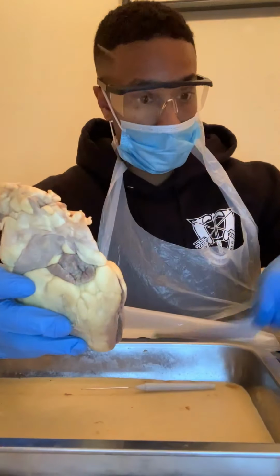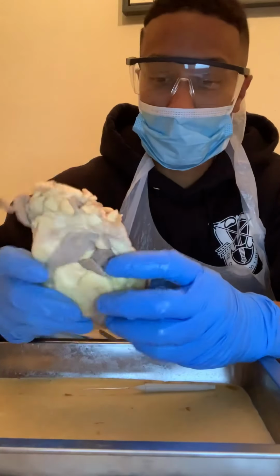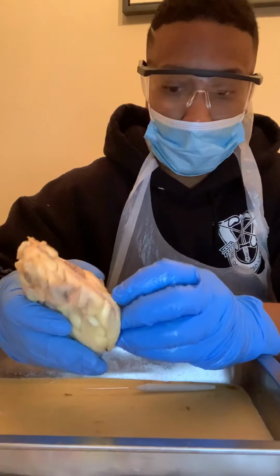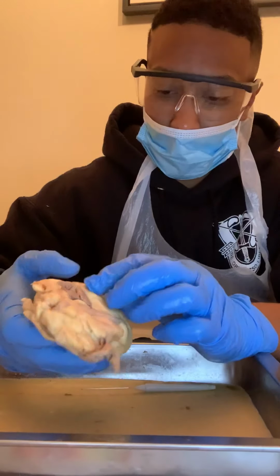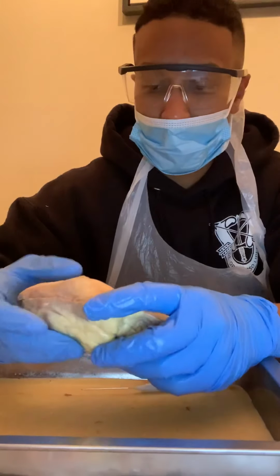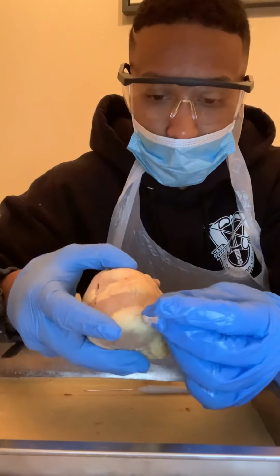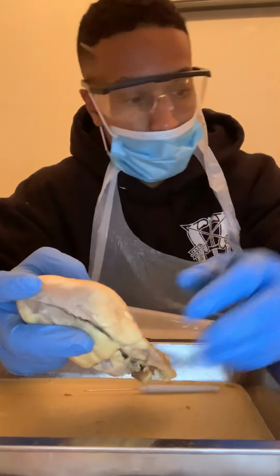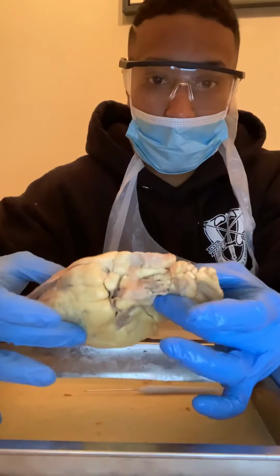All right, so the first thing is going to be the anterior portion. So pretty much what we can see from the outside view. All right, so the heart's supposed to come in the pericardium sac, which is kind of like a white structure on the outside. And right here, you can see there's a little bit of it left. This little piece that just fell off right there. So that would be the pericardium. It comes in an actual sac. The pericardium covers the sheep heart.